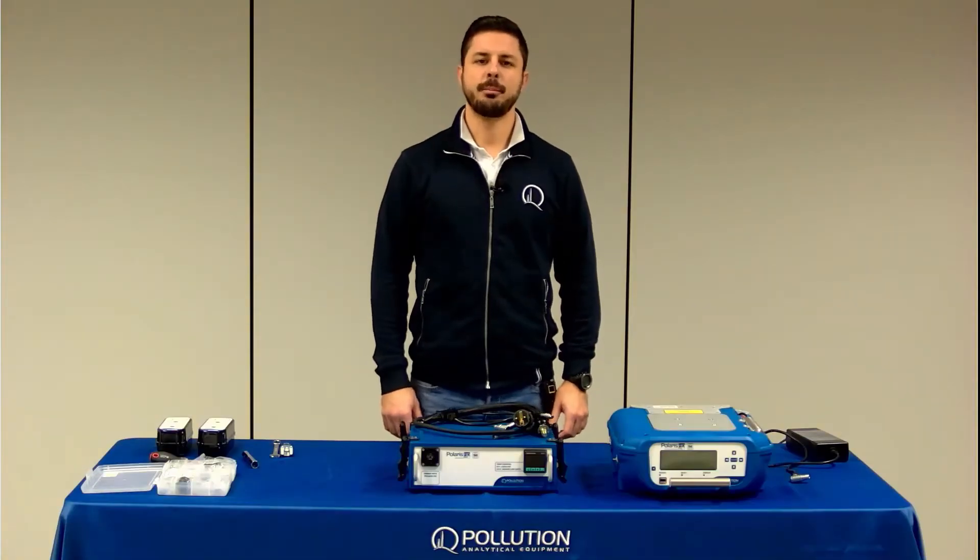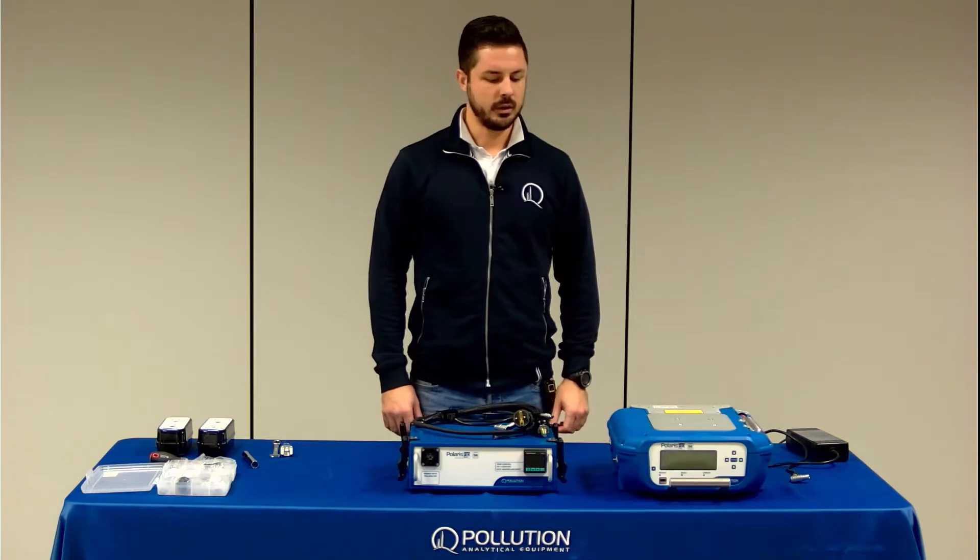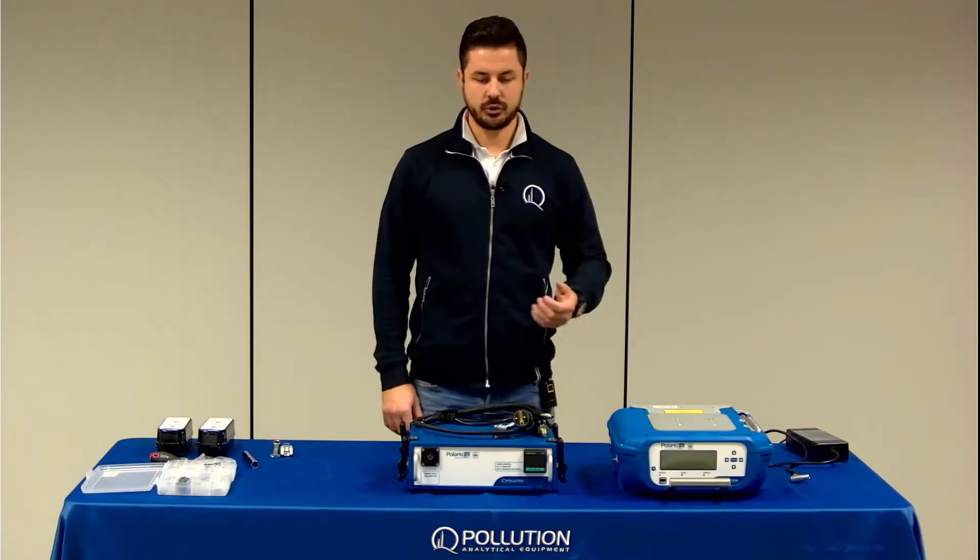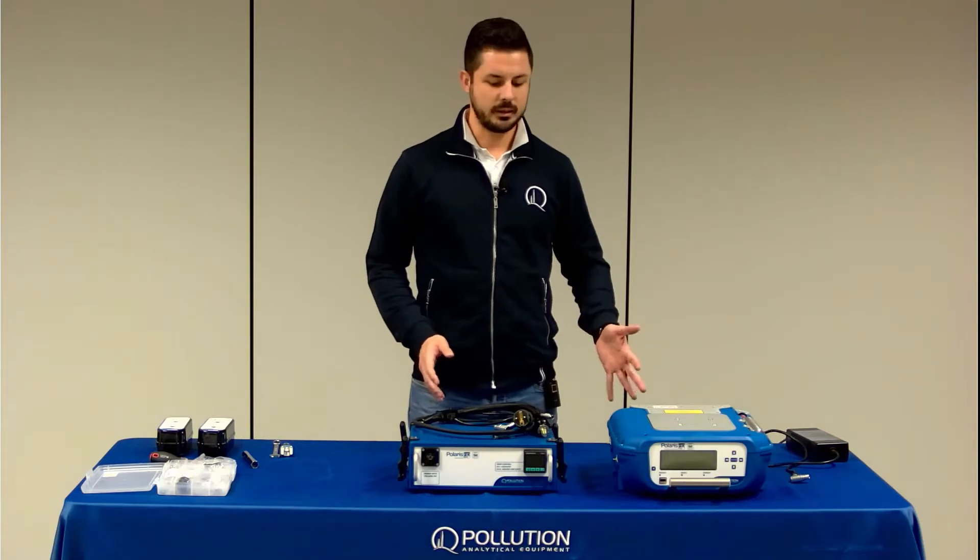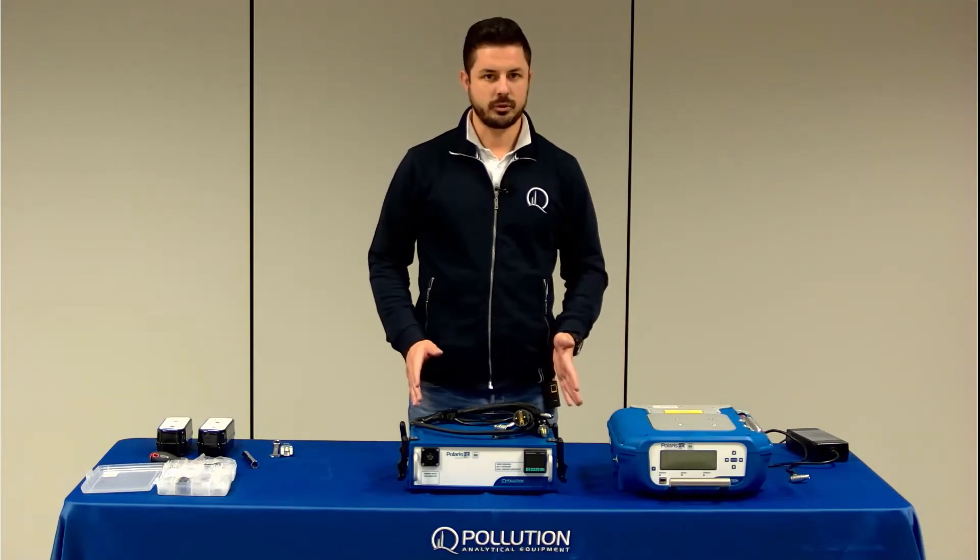Hi and welcome to this Polaris FID tutorial video. Today I'll show you how to use the docking station and how to connect it to Polaris and which are the correct operational procedures.